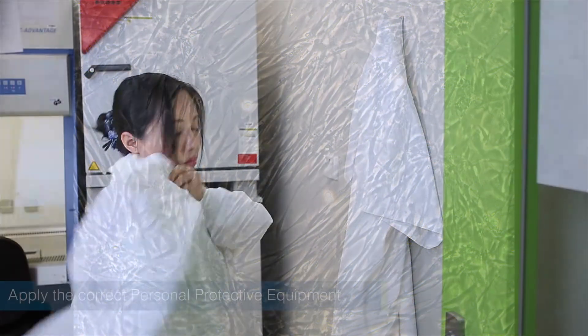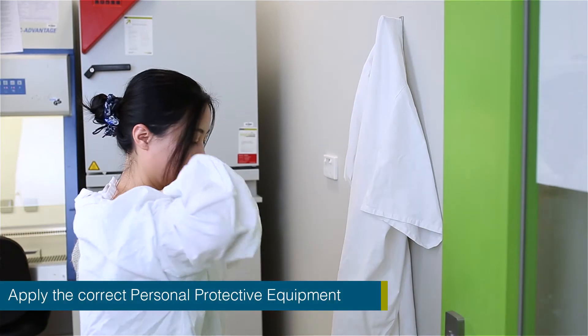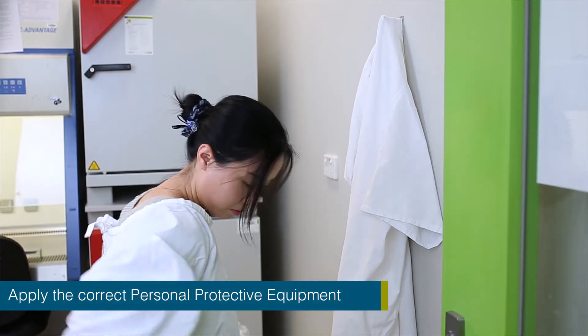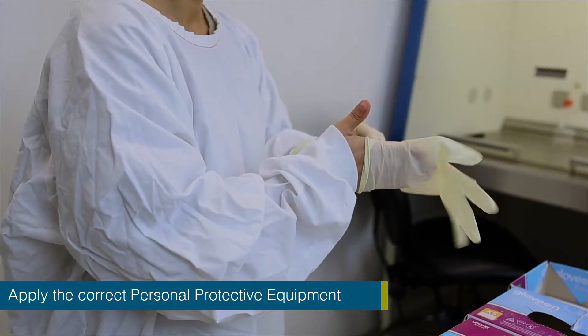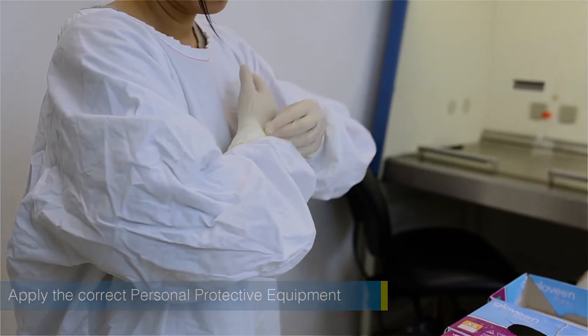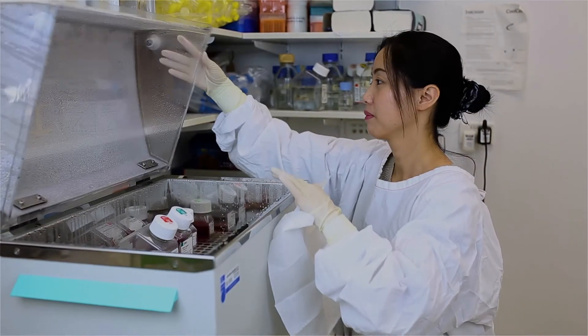Personal protective gear, such as a lab gown and gloves, are worn at all times when handling the cells within the biosafety cabinet. This prevents both contamination to the cells as well as to the researcher handling them.